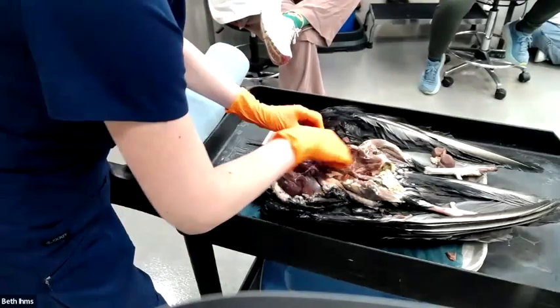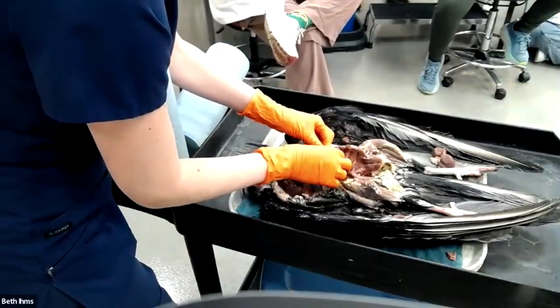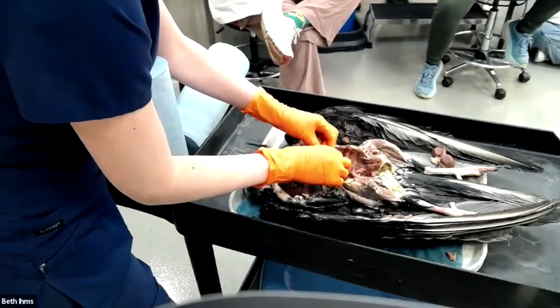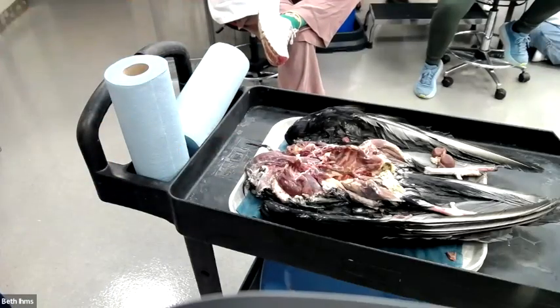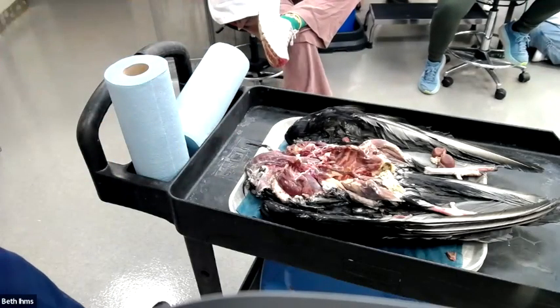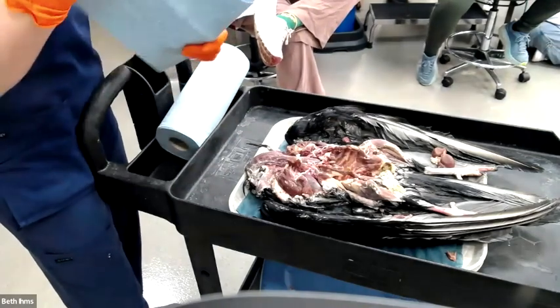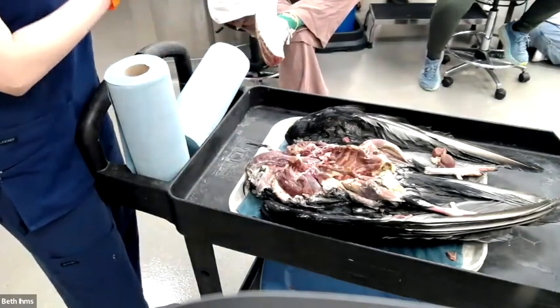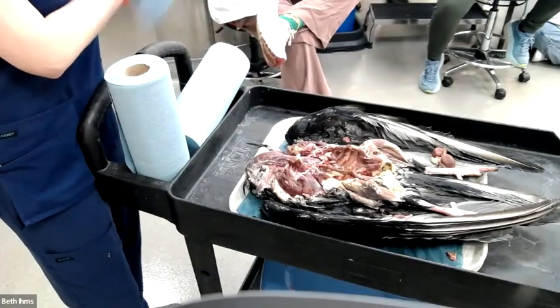The other thing in this guy, if you feel around his great vessels, he's got some little crunchy spots. So this is an older bird. Atherosclerosis and arteriosclerosis are very common in old birds. It does not usually kill them. It's usually subclinical, actually. Pretty much every old parrot I've ever necropsied has had some degree of atherosclerosis.